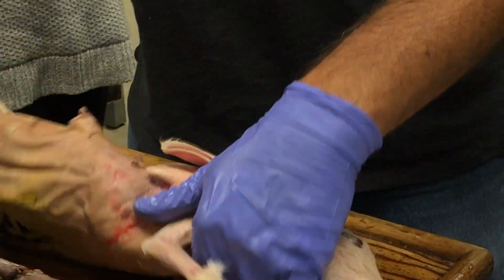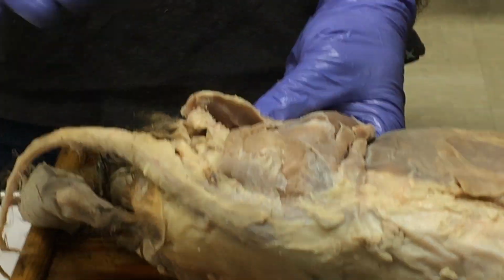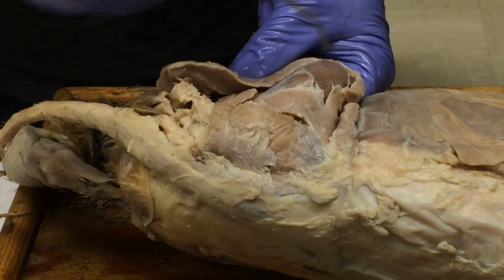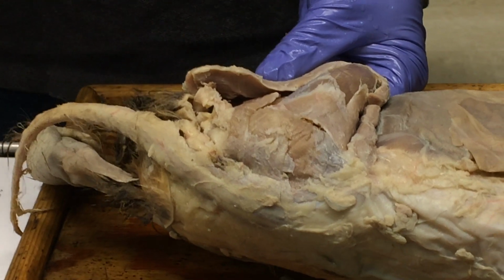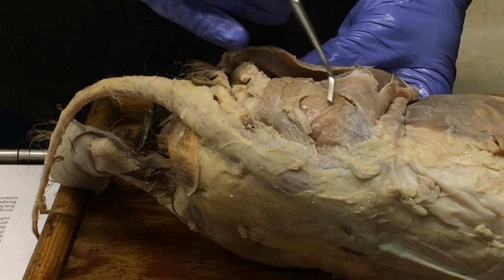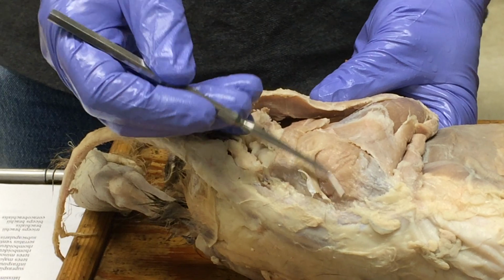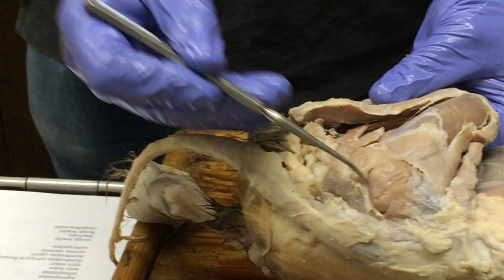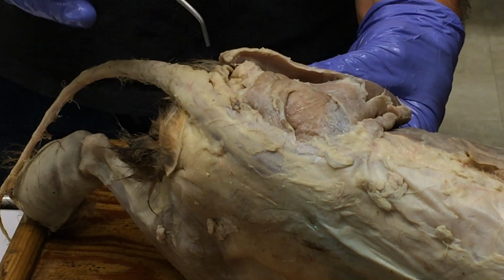Okay, then we get to the gluteal group, and those are the butt muscles. The tensor fascia lati here is actually part of the gluteal group. So that's really the most anterior of the gluteal group muscles. And then coming back from there, we have this big one on the pelvic girdle, and that's the gluteus medius. And that's actually the biggest muscle in these animals.